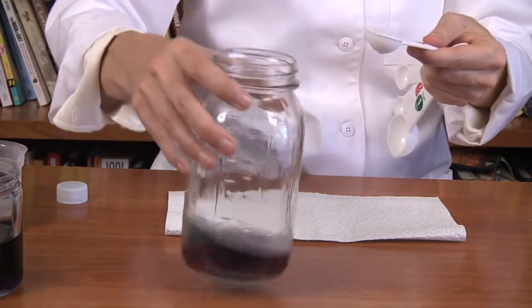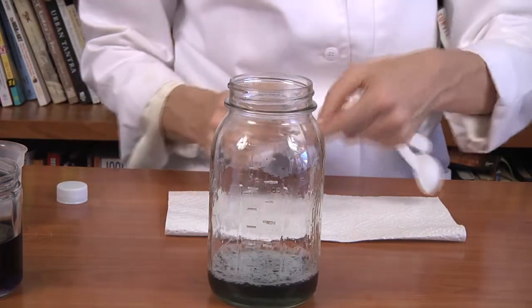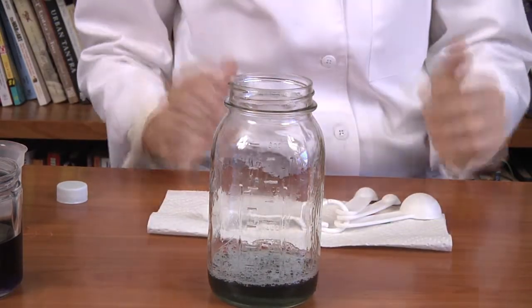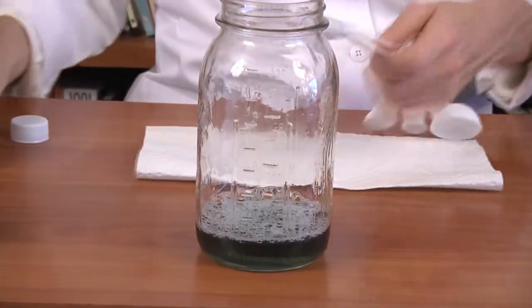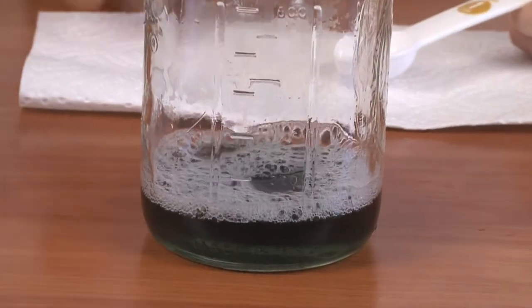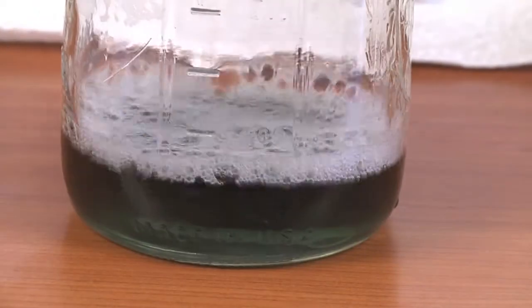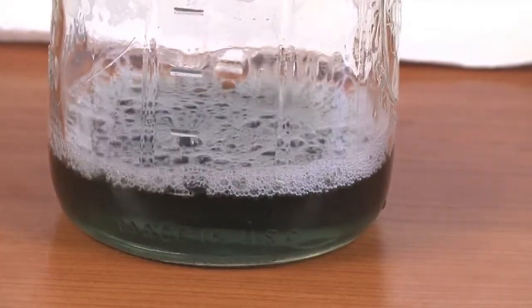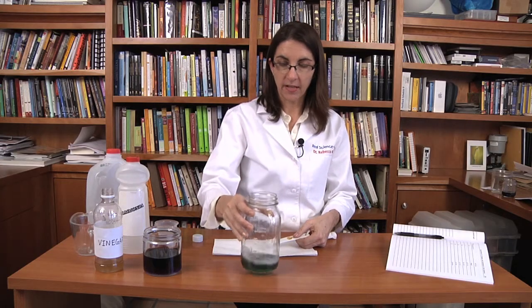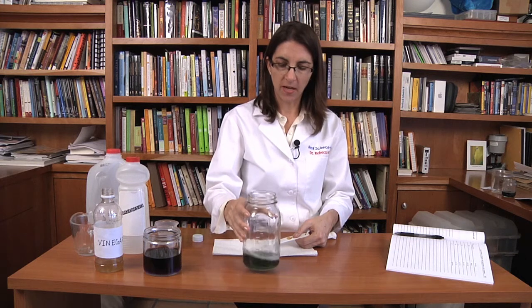Ten — and there we've gone over. So I lengthened out the experiment so that I can tell between eight and nine how the color change would occur. This tells me that we're basically right over the completion of the reaction. What that means is that all of the acid that was in the beaker has been converted to salt — we have salt and water, and we actually have too much base. If I continue to add base, you can see the color stays green, so the reaction has completed. I have converted all of the vinegar, all of the acid, into salt and water, and any more base I add is just turning the pH of the solution basic.